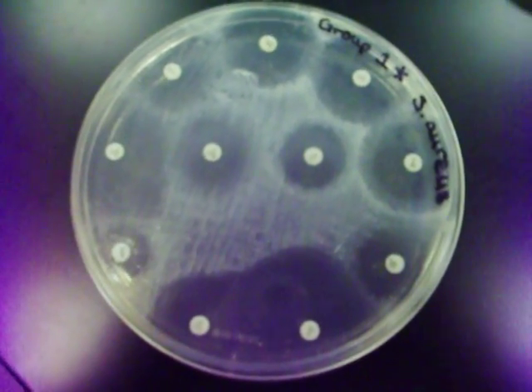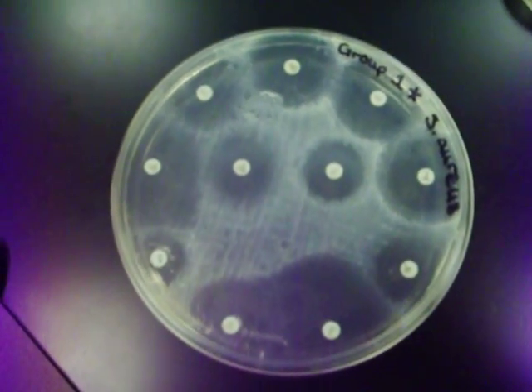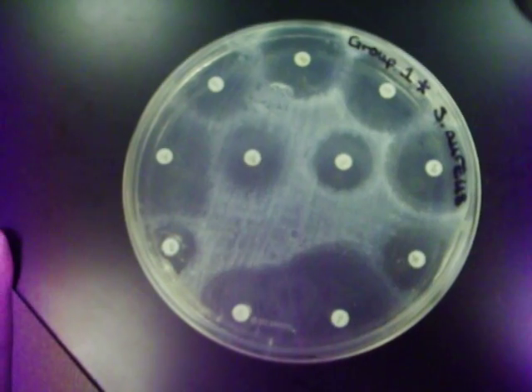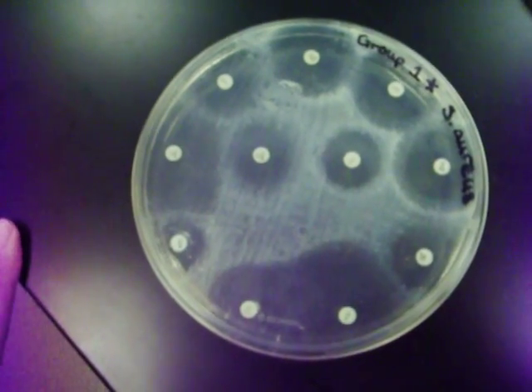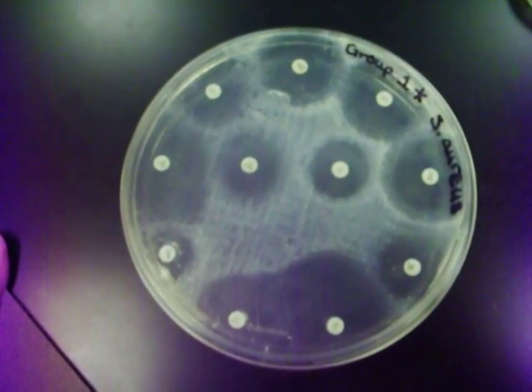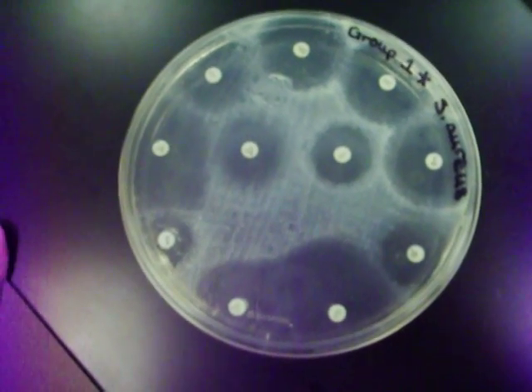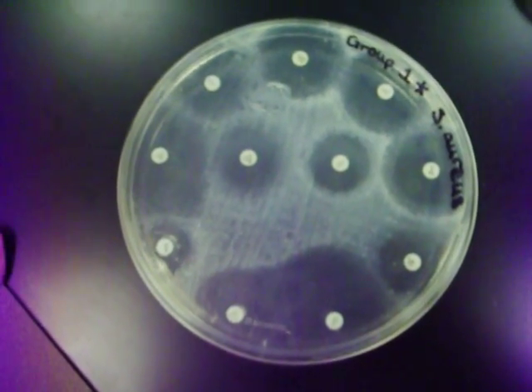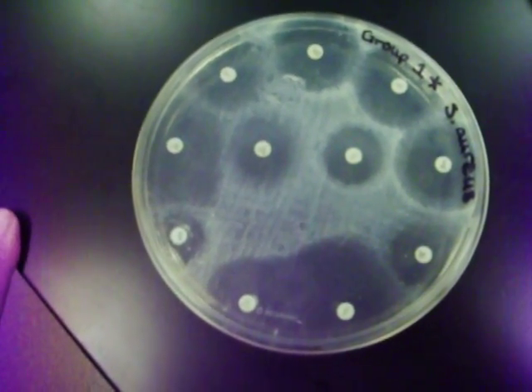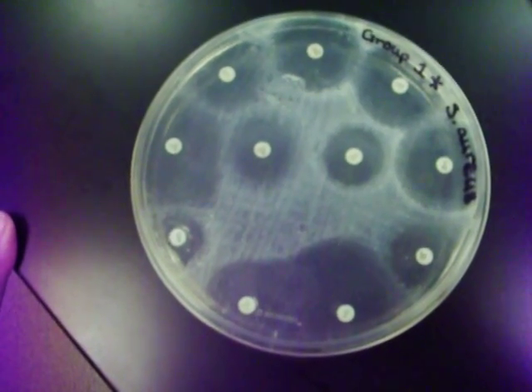This is the Kirby-Bauer test, which determines if certain types of bacteria are resistant or susceptible to different antibiotics.